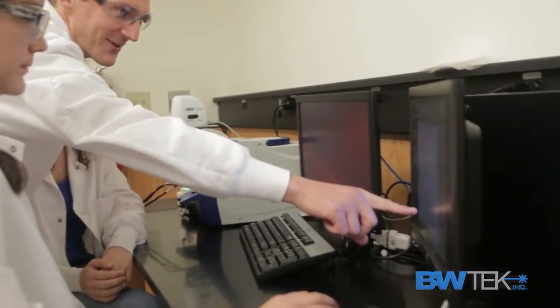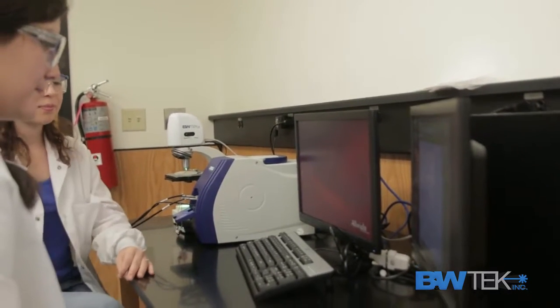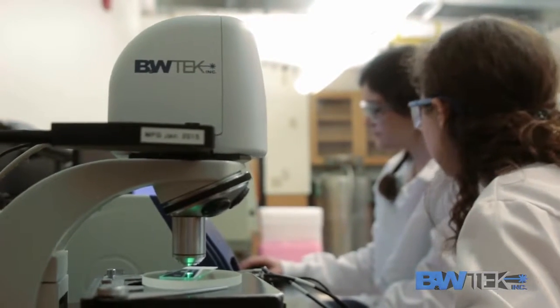We're looking at glass because it has a kind of weird network. It's not a set pattern, so you don't really know what bonds are forming where. It's not a crystal structure. So we're using Raman to basically test multiple samples and different compositions of glass, and we're looking for patterns in the way that the bonds form.